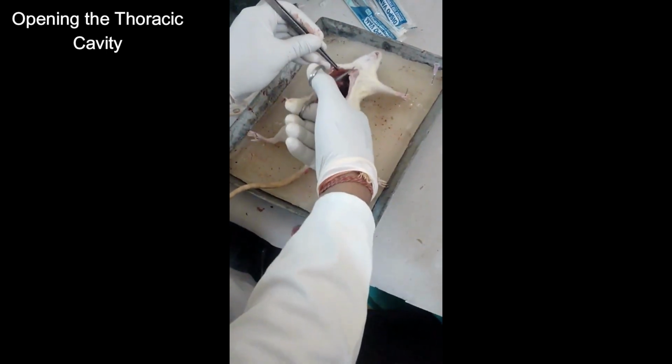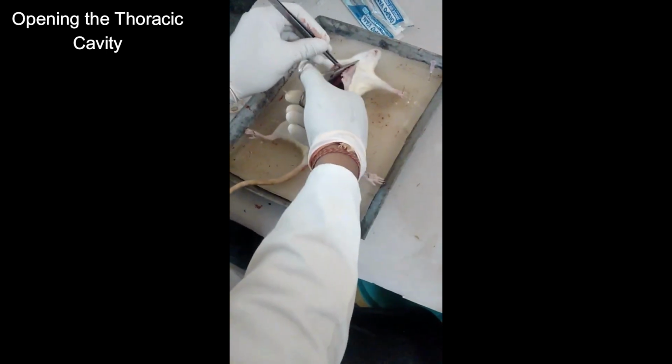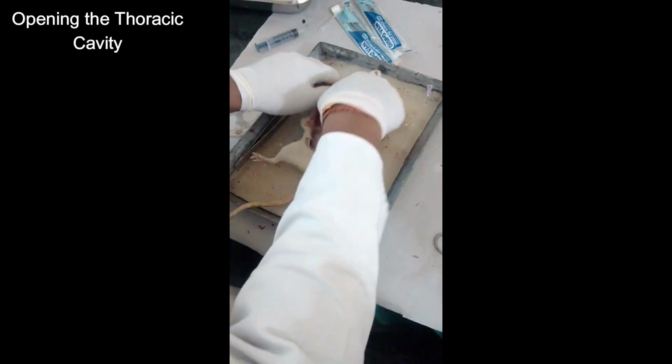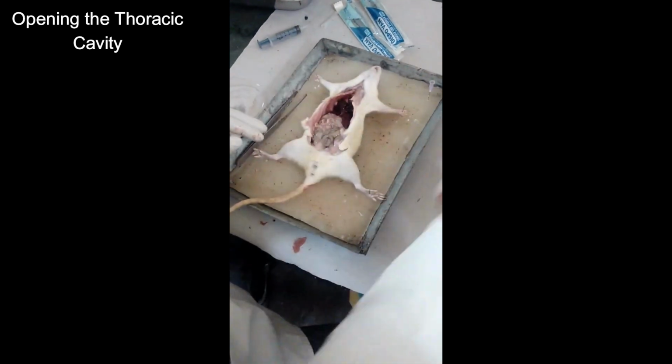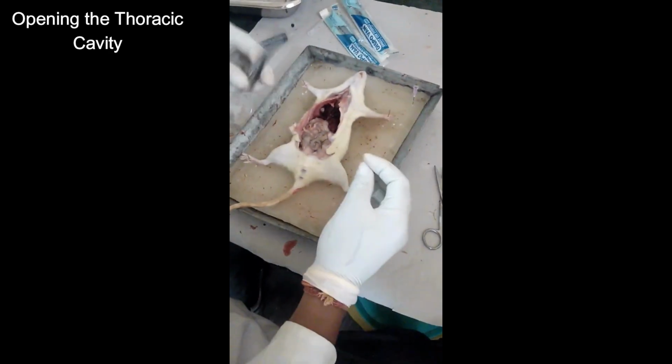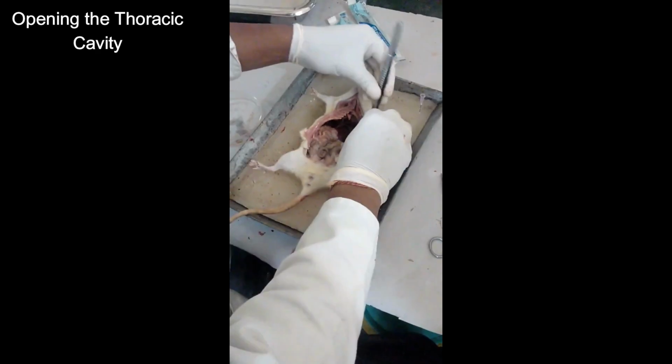Using scissors or a scalpel, make a midline incision from the lower abdomen up to the chest. Carefully cut through the skin only. Reflect the skin on both sides to expose the abdominal muscles. Now gently cut through the muscle layer to open the abdominal cavity.